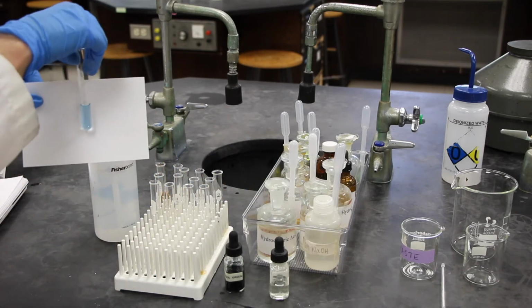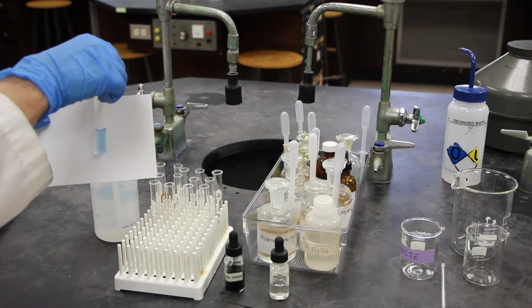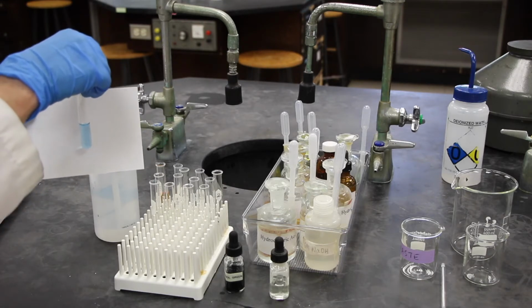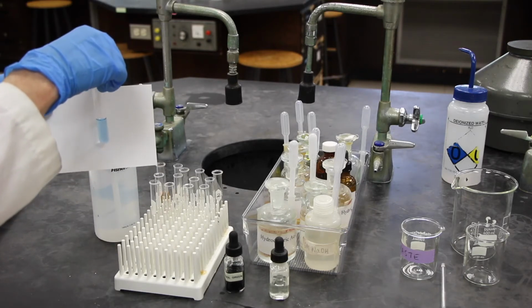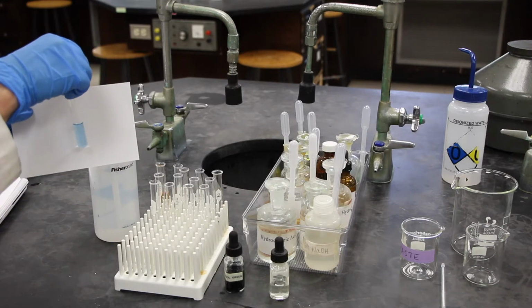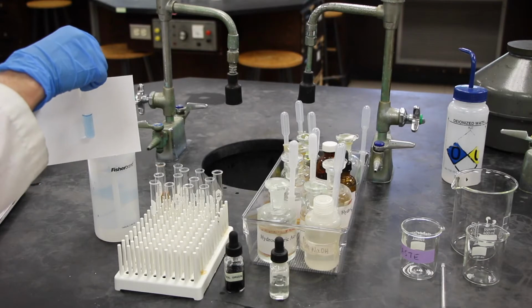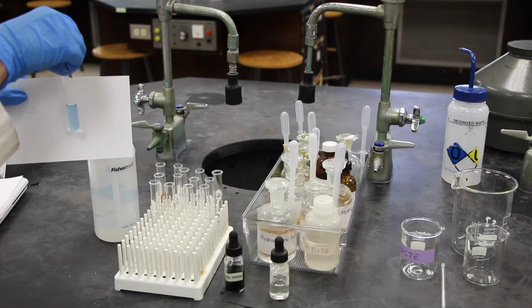I'll help you answer the first one of this, and then you are on your own for the rest of the observation and interpretation. So the stress on the system, we added sodium hydroxide, the Na plus ion and the OH minus ion, and the OH minus ion is the stress that we've added. The direction of shift should be right, and the observation is the solution turned more blue. It looks a deeper blue to me.